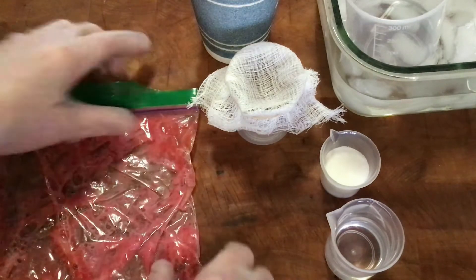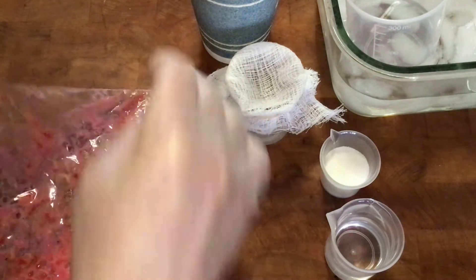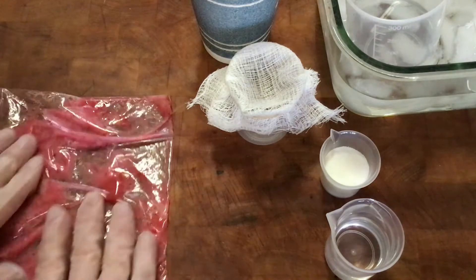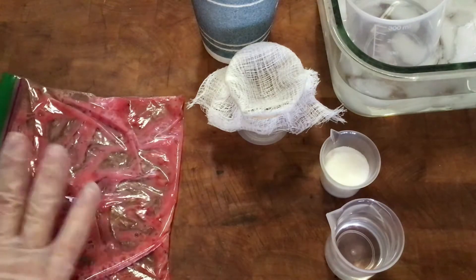You can see it's kind of inevitably getting sudsy, but if you mush it really aggressively it gets really bad. Just mix it all in there really well.